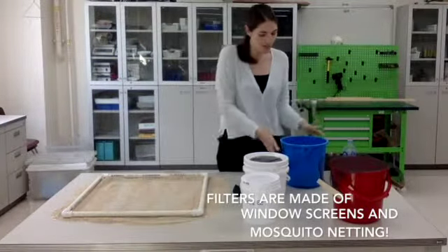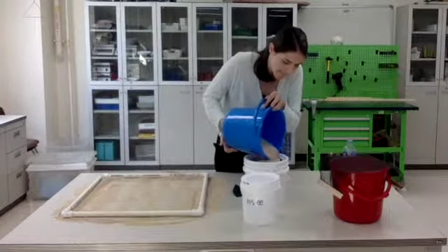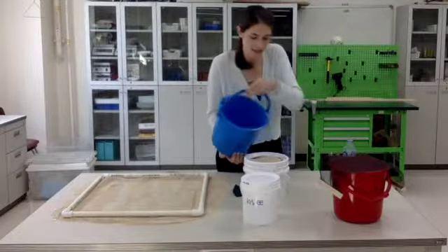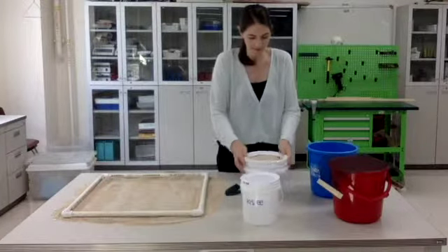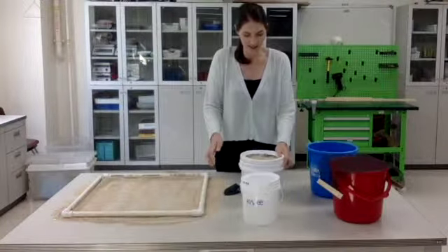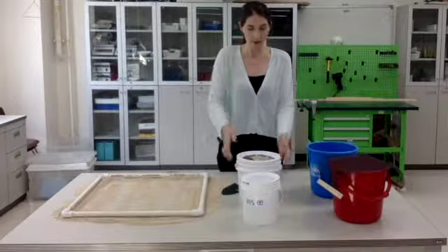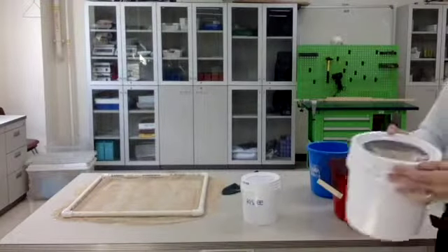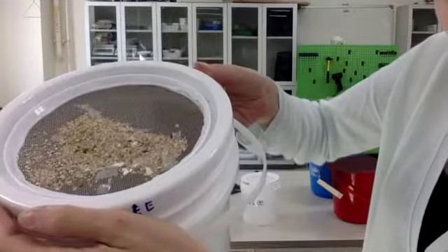So I'm going to start to pour my sand into this bucket. And the little pieces, the little sand particles, will go down. The bigger particles, like the plastics, will stay on top. Also big particles like rocks and whatnot. So wow, I actually have a lot of pieces of plastic in there.